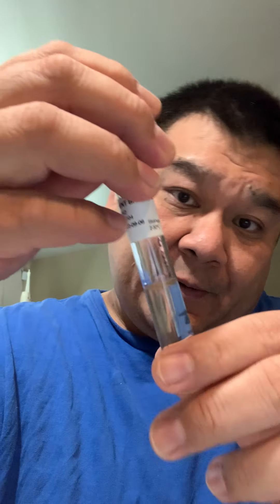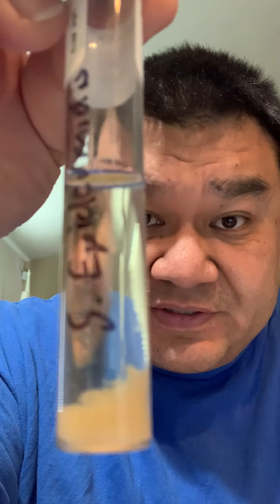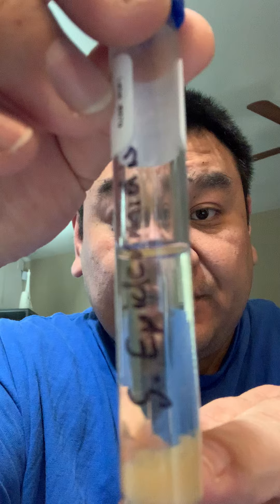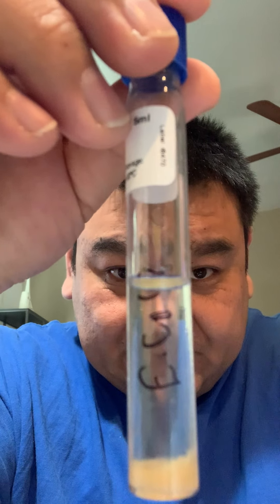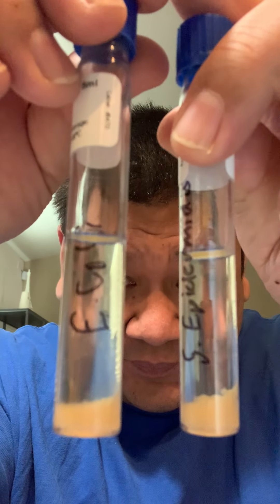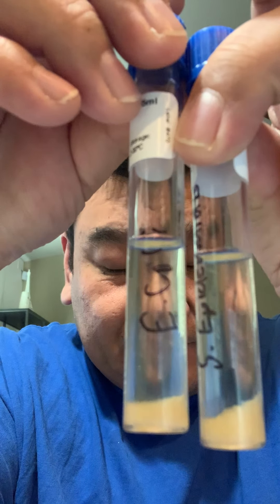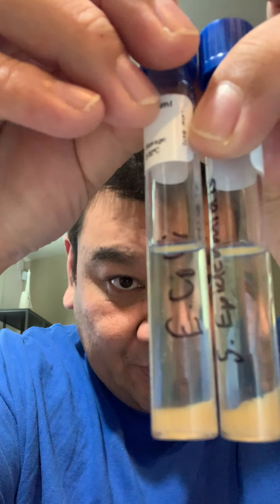Here are my results for experiment 1. As you can tell, it was able to separate the bacteria. And here's my E. coli — it's also separated. Both of them are clear, and nothing floated up; it settled to the bottom.